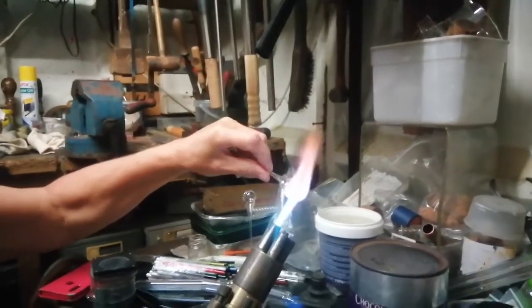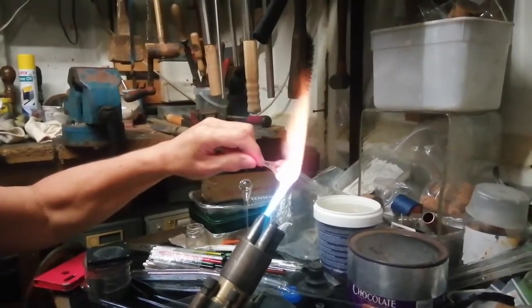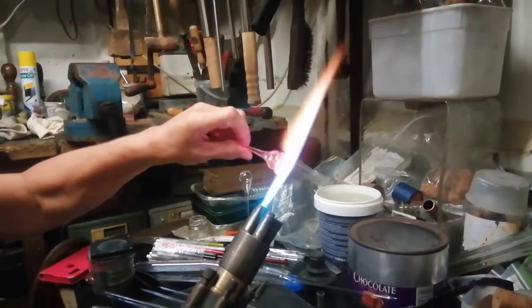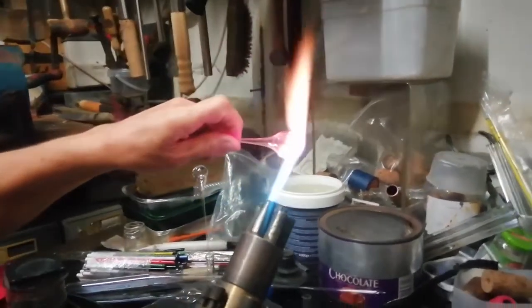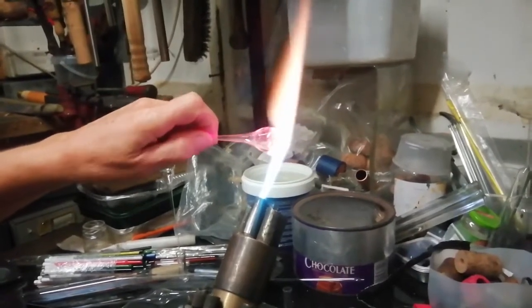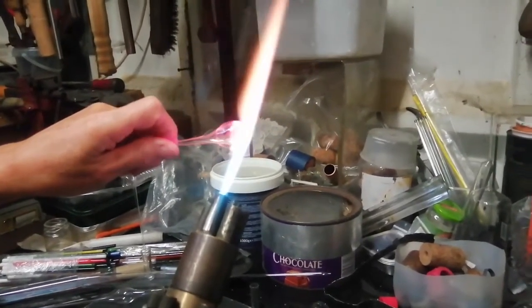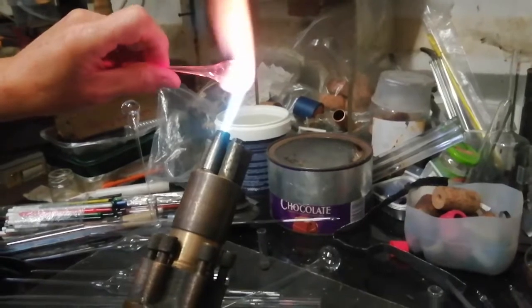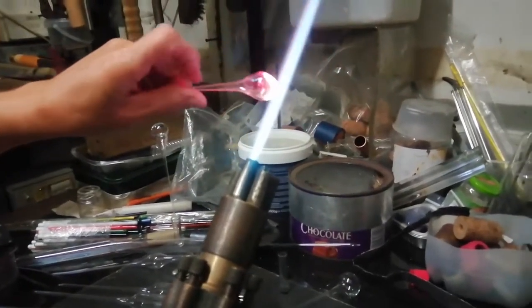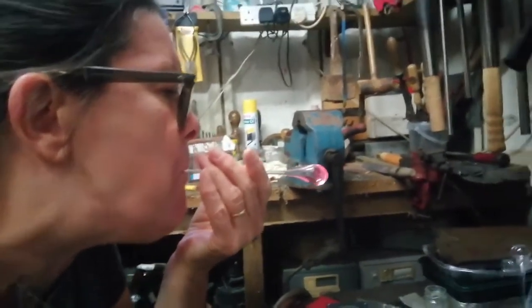This time we're hoping to blow the bulb shape. So bring the flame along more onto the parallel part of the tubing. Make sure the glass is nicely in the middle of the flame. That's it, going a bit further. Heat a bit further to the left. Keep it in the flame a bit more. Keep those fingers nicely relaxed. We'll take it out to do a nice blow. Blow as high as you can. Excellent, excellent, excellent.